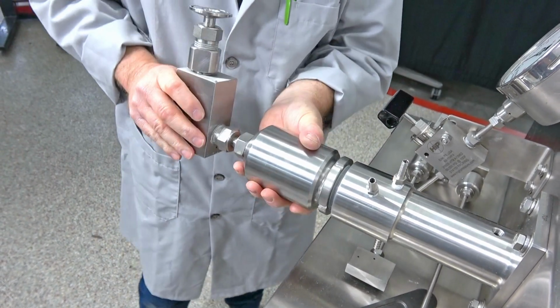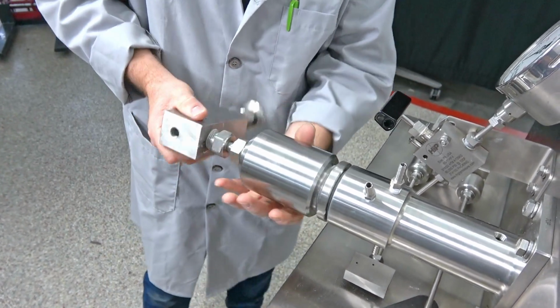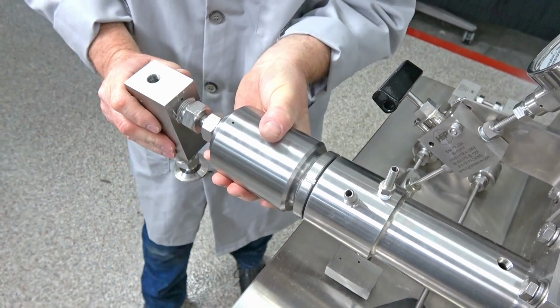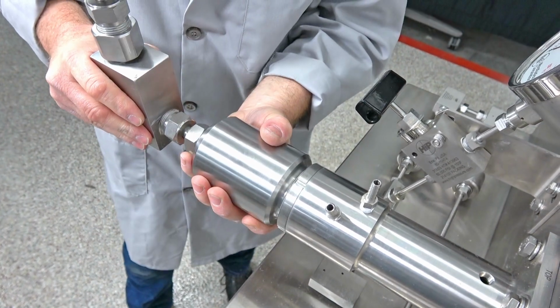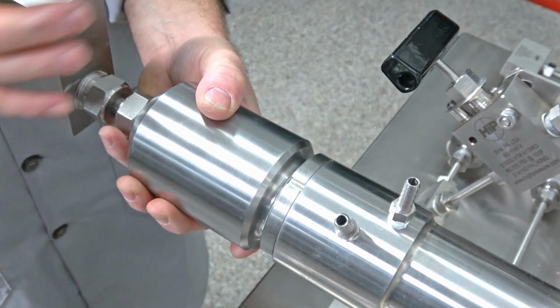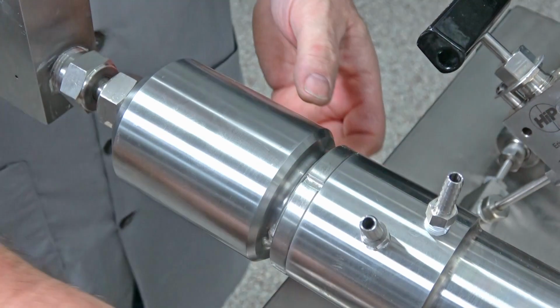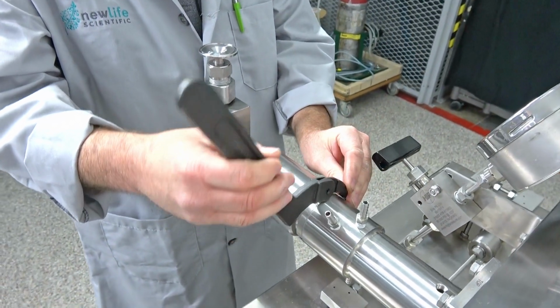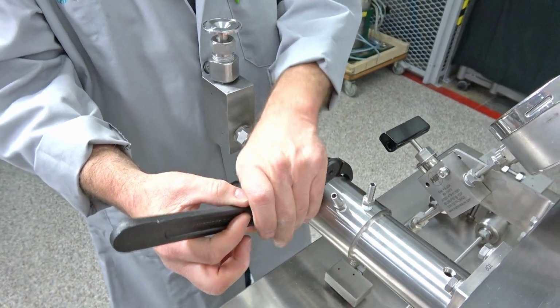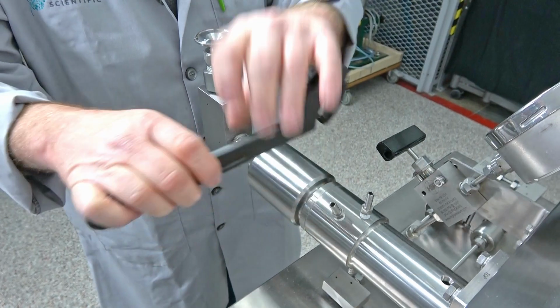And again, we left our collar there, so we know where we got to stop. And there it is. So we know that this goes straight up here, and we know that our collar stops there. So that's where we take our spanner wrench, hook it on there, and give it a little tap down to lock it.